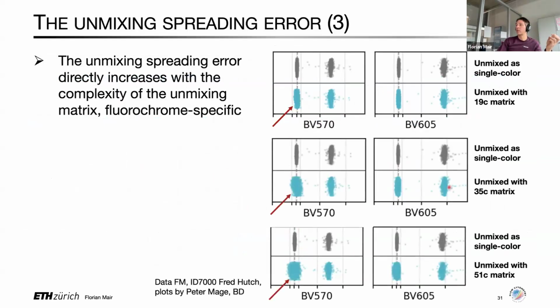So here you can see again two single stains, the same type of plots, where the upper row would be the respective single stain unmixed as single color. And down here you can see the same single stain unmixed in the context of a 19-color unmixing matrix, where you can actually see a slight hint of that effect taking place already. Here unmixed in the context of a 35-color unmixing matrix, where the effect becomes more pronounced. Or here we are back to the 51-color unmixing matrix, where the effect is quite drastic, as you've seen it on the previous slide deck.